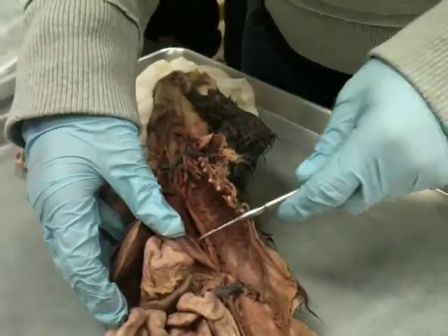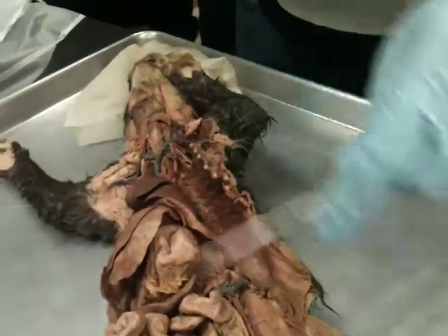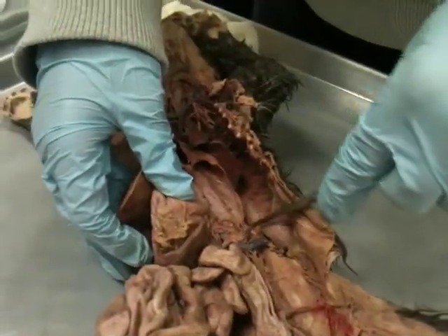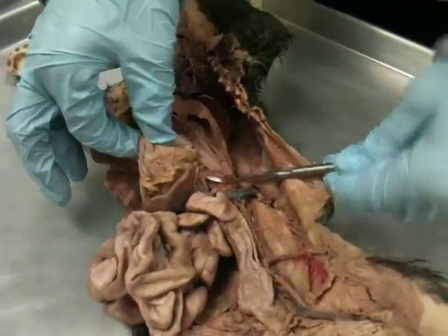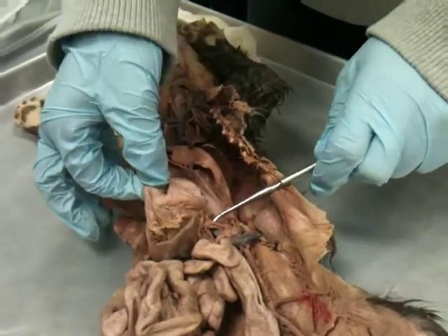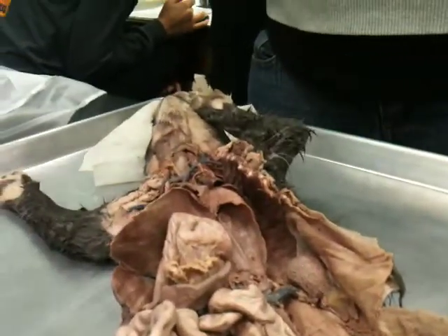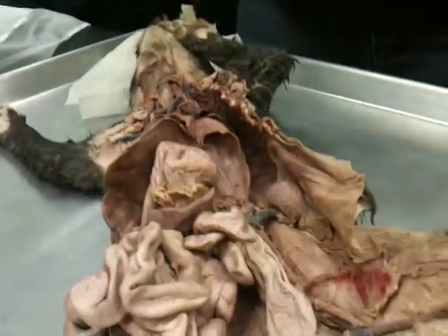And then we can see that division between the thoracic cavity and the abdominal cavity, right? You can see the remnants of the diaphragm here. And the aorta goes all the way down, but we can see there's this branch here that goes to the stomach. So what do you think the branch to the stomach is called? Celiac artery. Yeah. One celiac artery, or celiac trunk. Either one, because when it's called the trunk, it just means there are usually a lot of branches coming off of it.